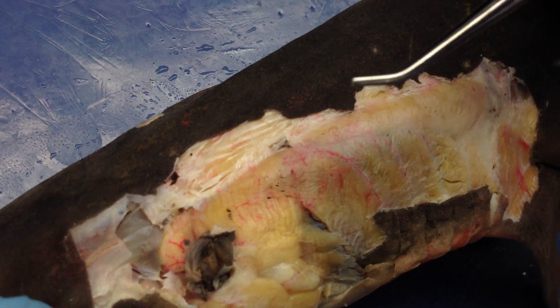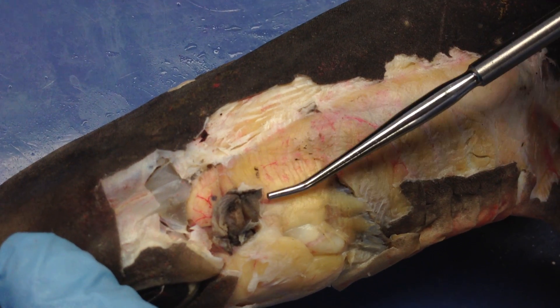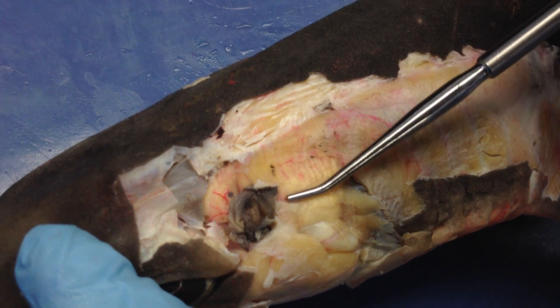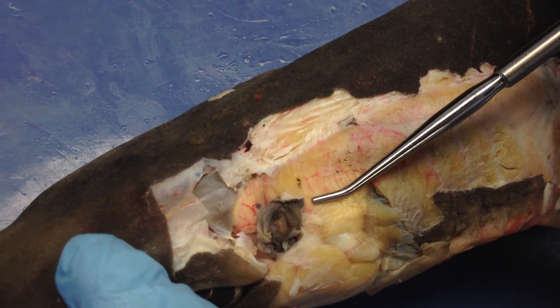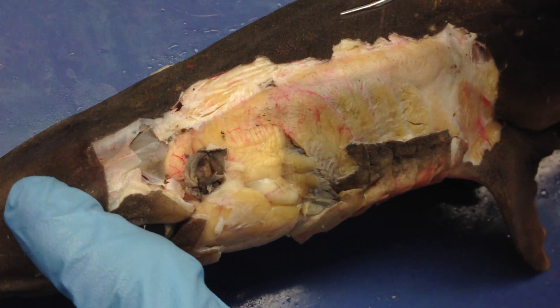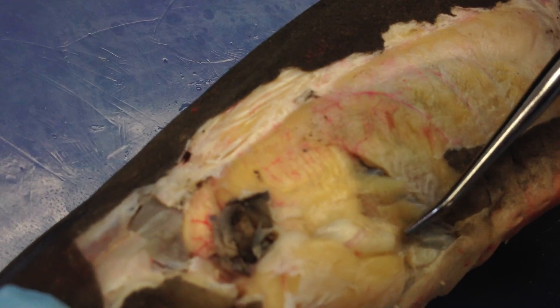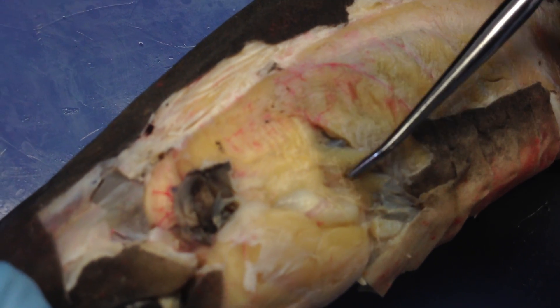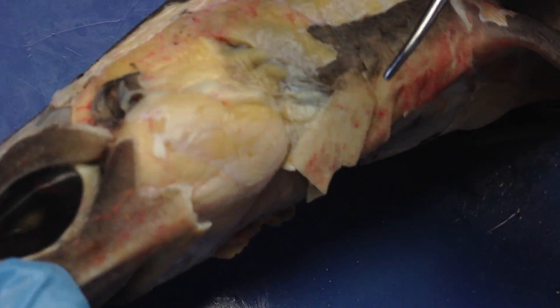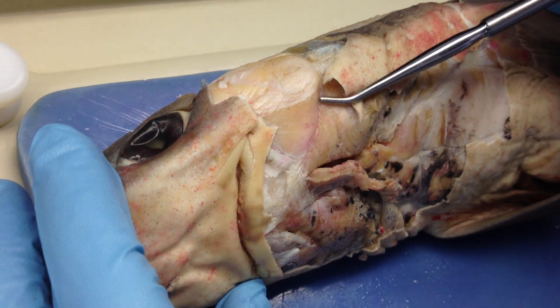The levator hyomandibulae is right caudal to the spiracle, right here. The dorsal hyoid constrictor is this little portion right here, and then the ventral hyoid constrictor would be right here.